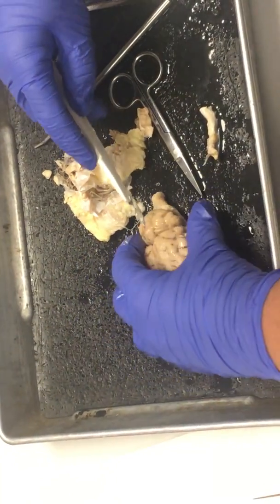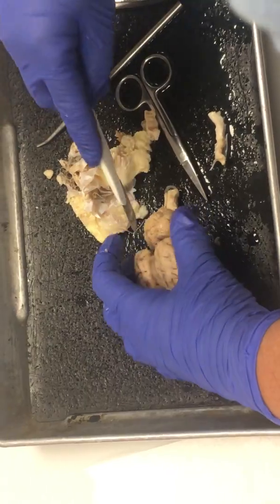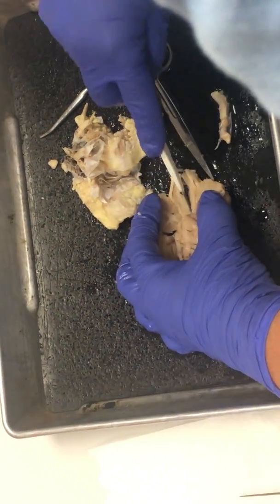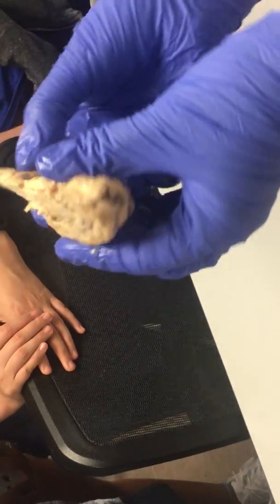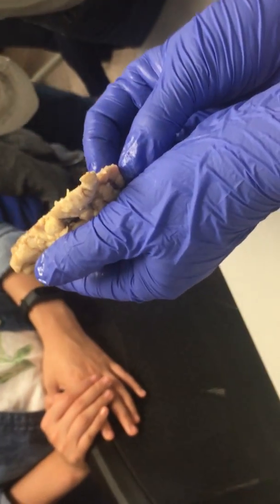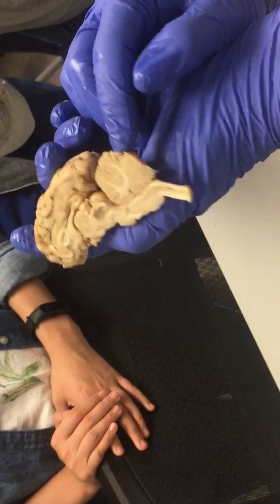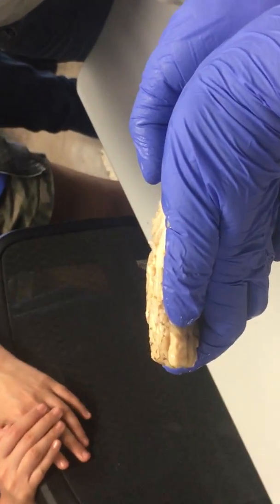I'm going to cut through the cerebellum and the spinal cord and the brainstem so we can see these structures. Now we can see the various brainstem structures. You can see the arborvitae of the cerebellum — remember, the white matter is called the arborvitae.